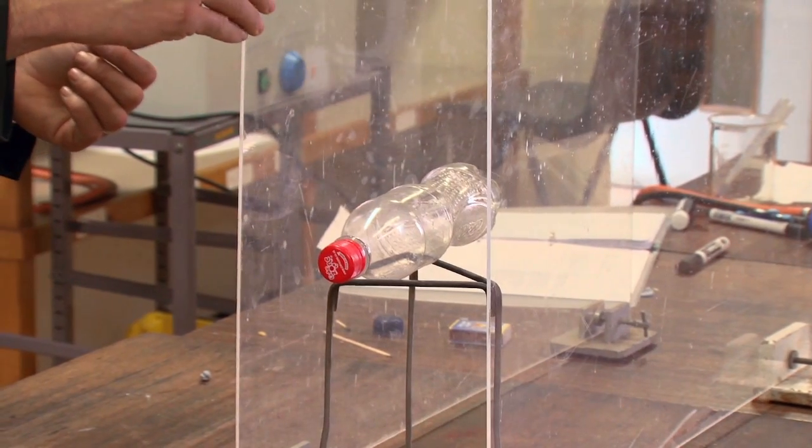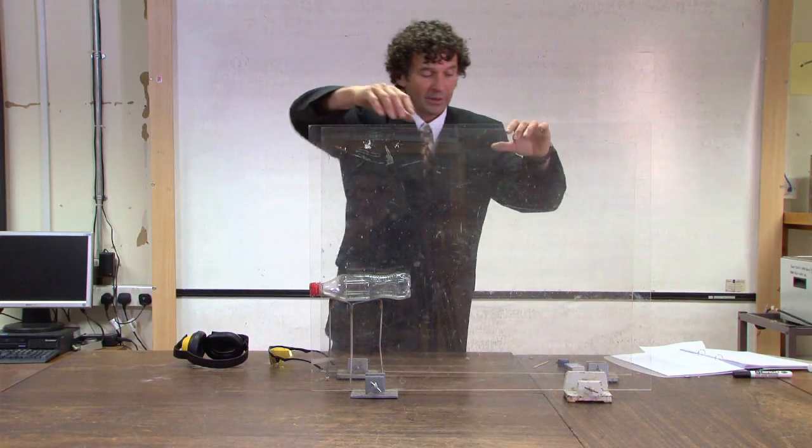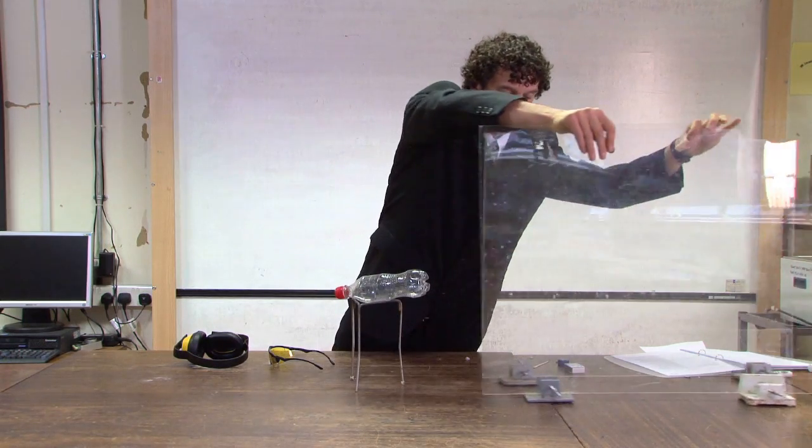In terms of safety, you have a safety screen, possibly best to sandwich it between two safety screens to protect yourself and ensure that no students are around.